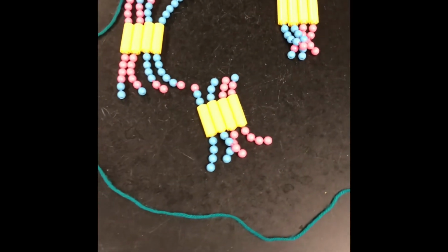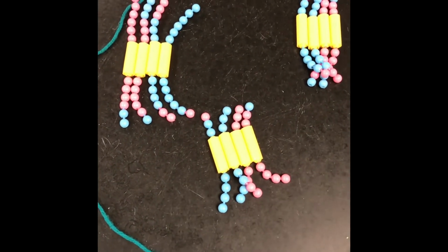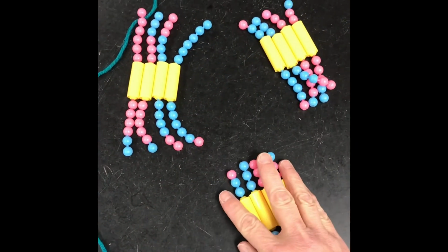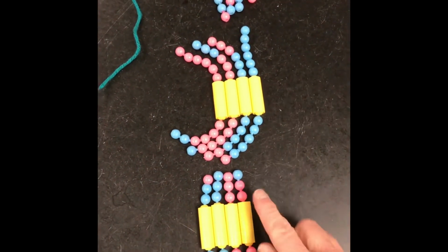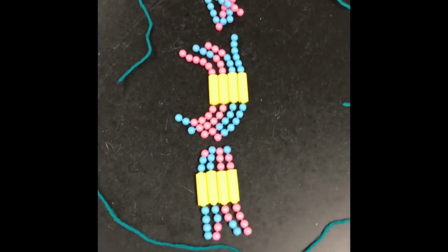So you are looking now at prophase 1 of meiosis. The rest of this is pretty easy because if we move from prophase 1 and go to prometaphase, they start to go towards the middle. If we go to metaphase, it's going to look like this. But like I said, more variety is they could lay with maternal on the right, but like this one, maternal's on the left. So that's metaphase 1.